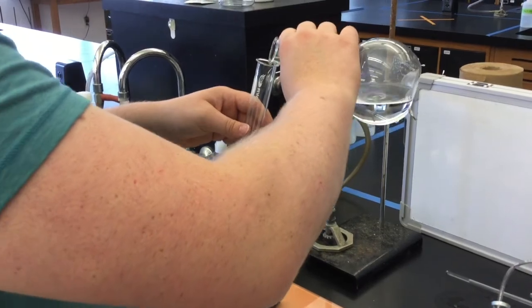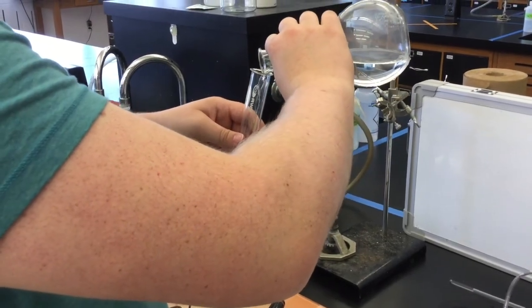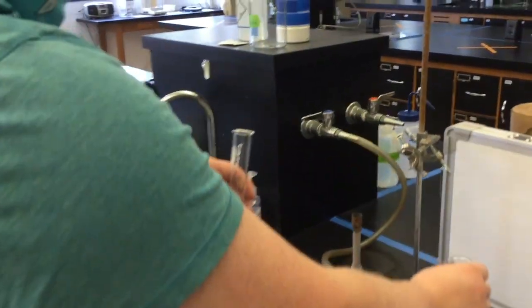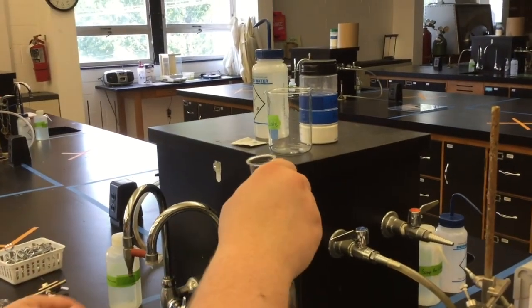Use a small amount of water to rinse the waste material from your test tube into the waste container on top of your sink.